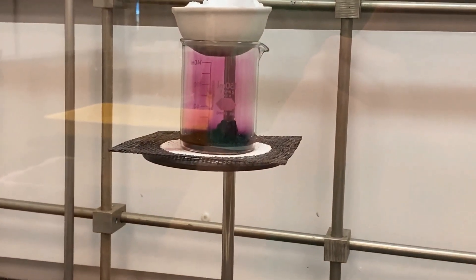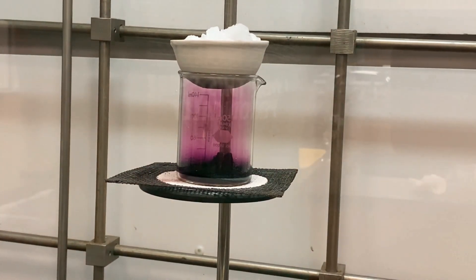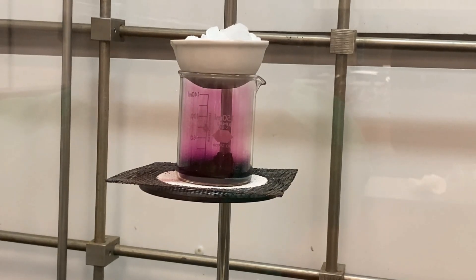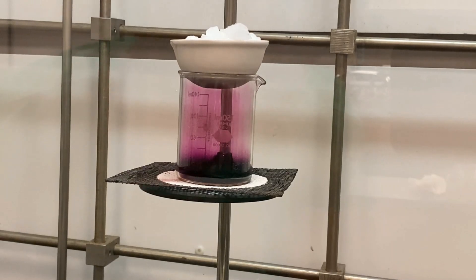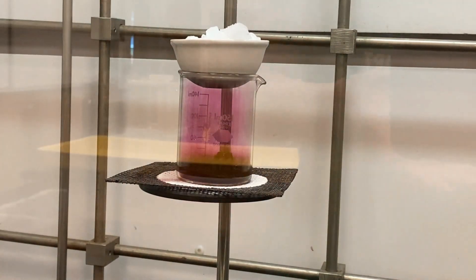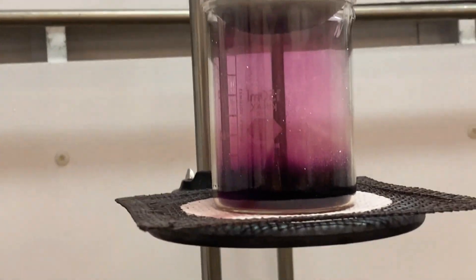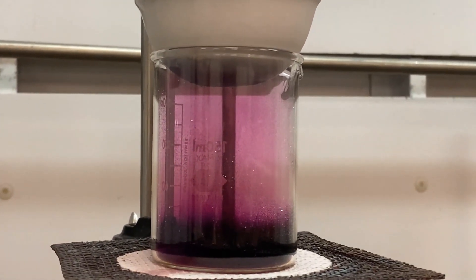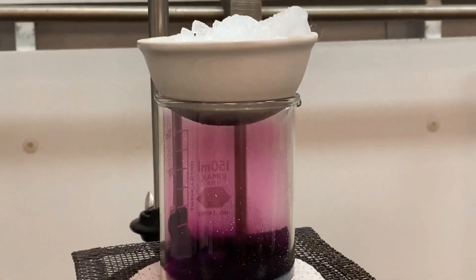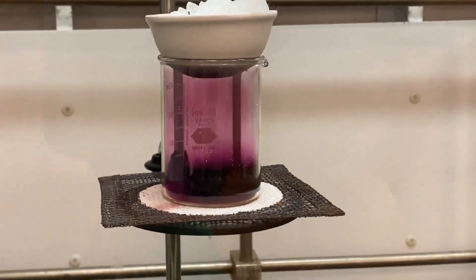Let's take a closer look at what's happening inside of the beaker. Notice how the bottom of the evaporating dish looks different than it did at the beginning of the experiment. Instead of being a clean, white evaporating dish, there is now some sort of substance that has collected on the bottom of the cold dish.